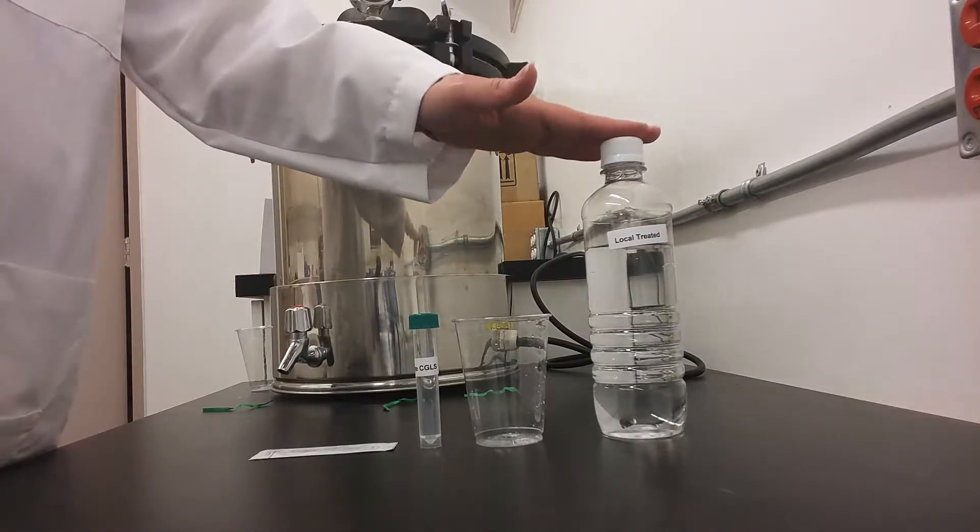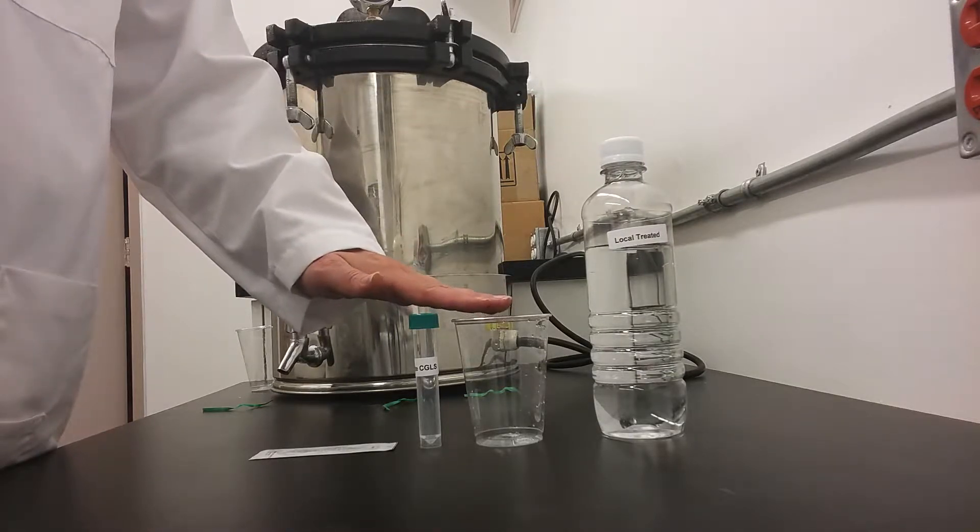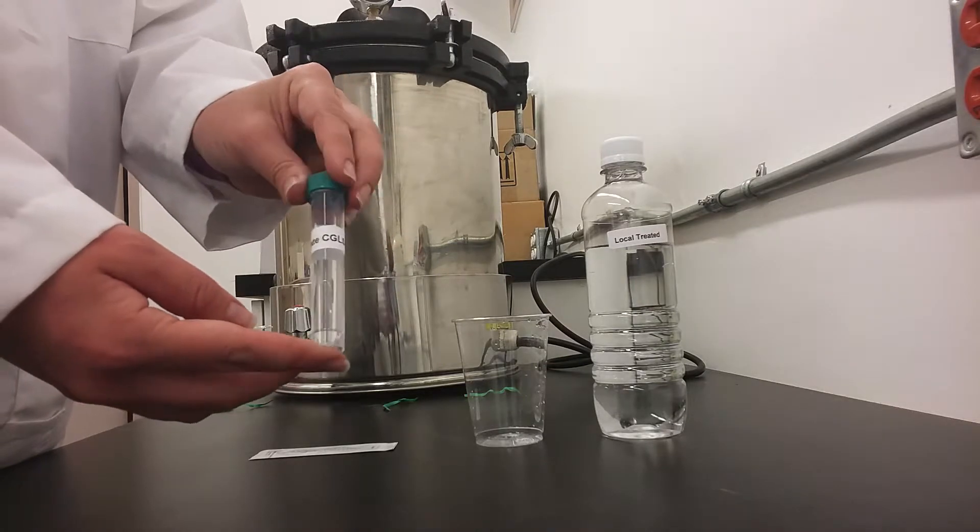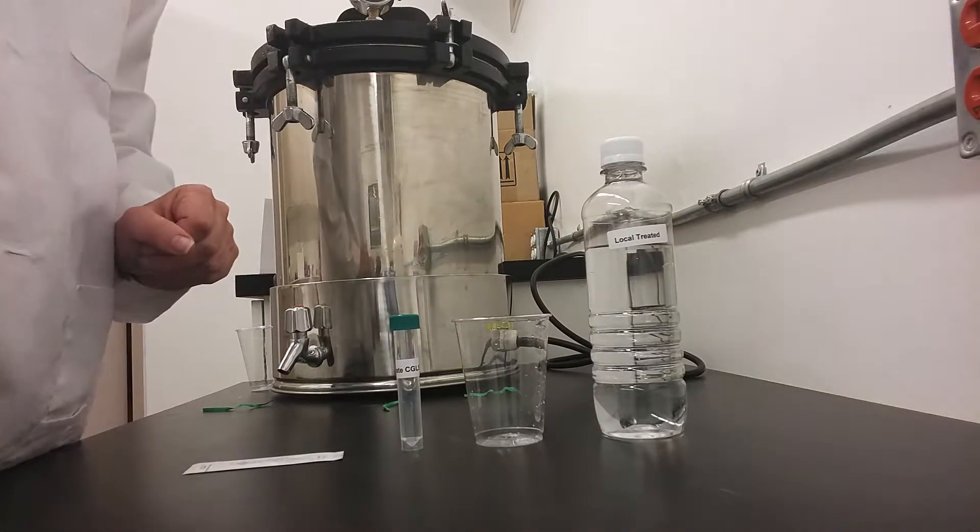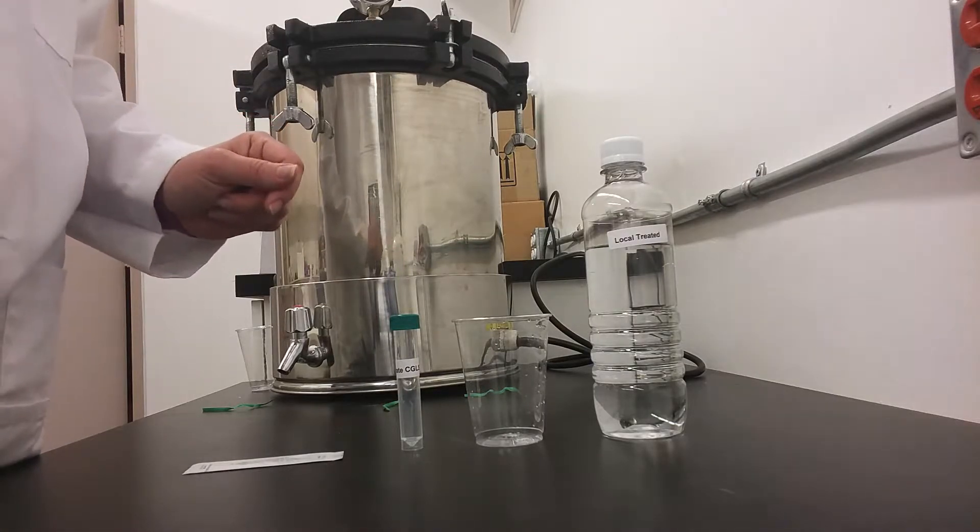For the nitrate test, you will use whatever source water you are choosing to test and an empty beaker. There is also included the Nitrate Canadian guideline sample, and that is the one we will be testing for this demonstration. Because it already comes in a vial, you do not need a separate beaker for that.